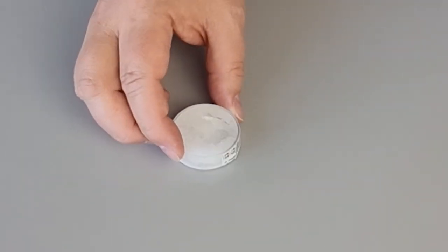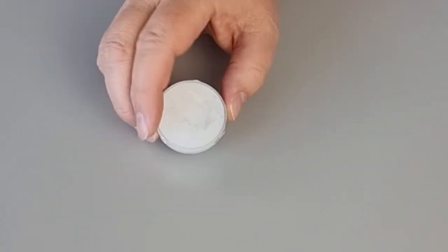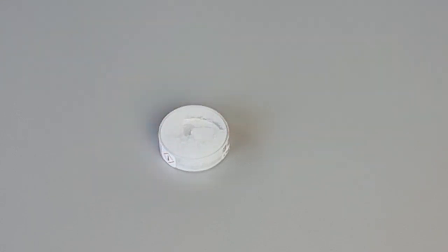For a standard whose water activity is higher than room humidity, what you'll see is a loss of moisture causing there to be hard, full crystals in the bottom of that standard, in which case it's not going to read correctly because of that water loss.